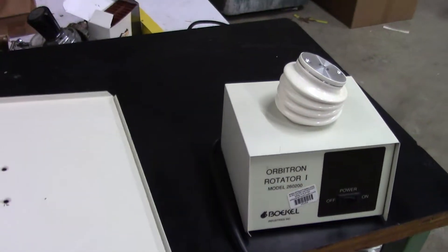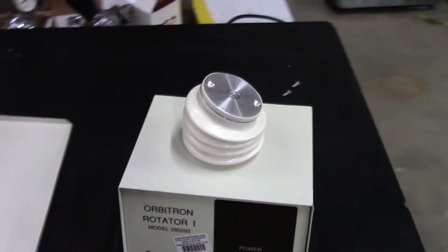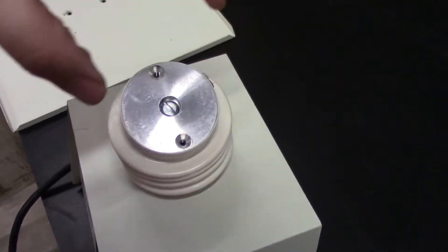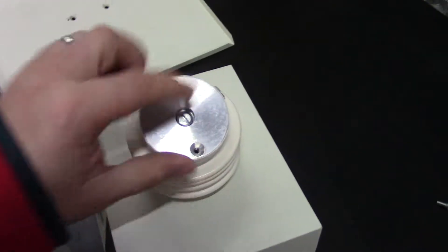In the shipping process, we disconnect the top. I just wanted to point out to you, this top does become detached. This does pull out. All you do is snap it back in.